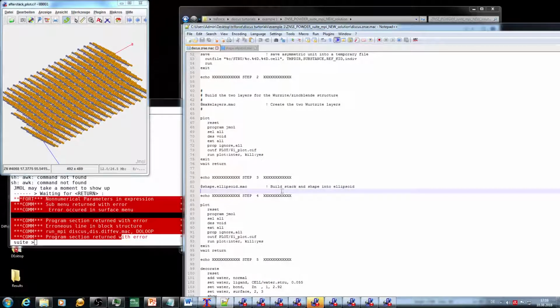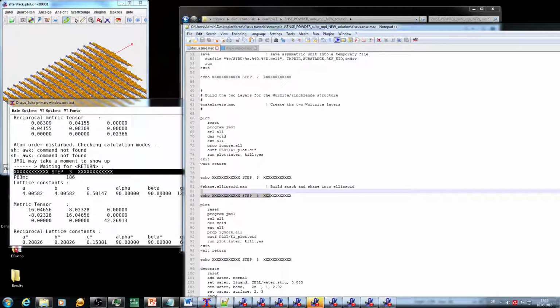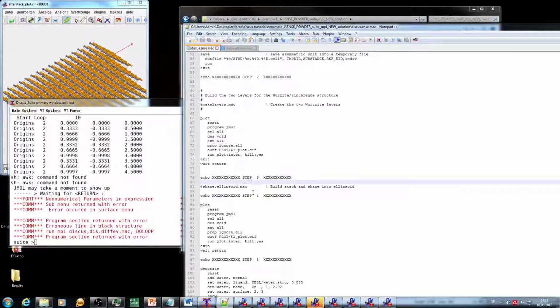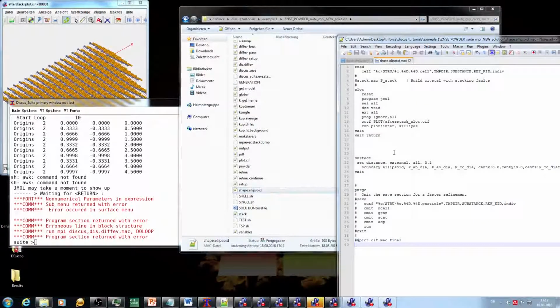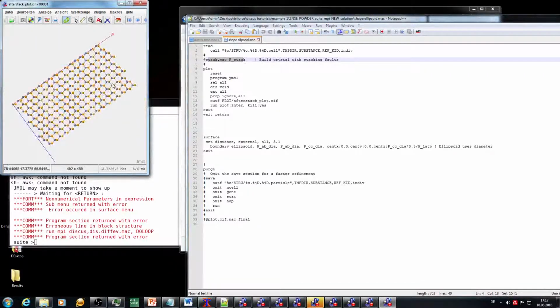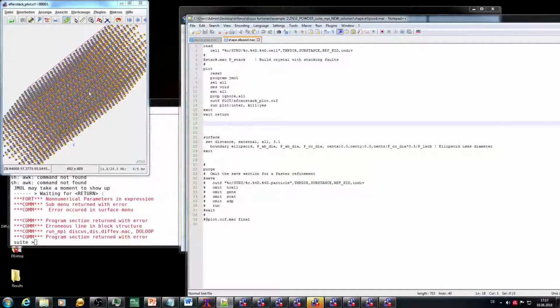So what have we learned from that now? We have seen we are waiting for step 3. Step 3 is here, but we haven't seen step 4. It's not coming up. So the error needs to be between step 3 and step 4, which is in the ellipsoidal macro. Luckily, I have already opened the ellipsoidal macro here. I can just open it again, and yeah, that's the macro. Pretty much what you see here, there's a macro which creates a stack. The stack looks pretty fine because we have the plot here. So until that point, everything is going right.